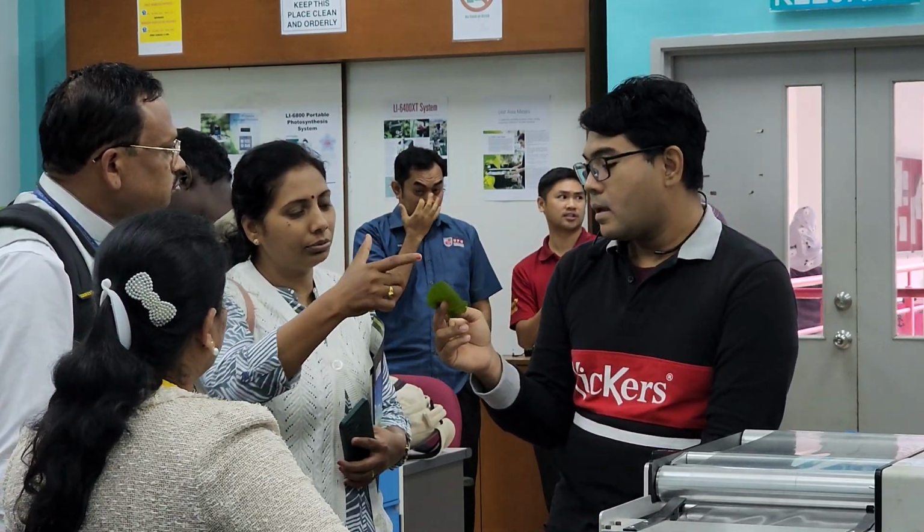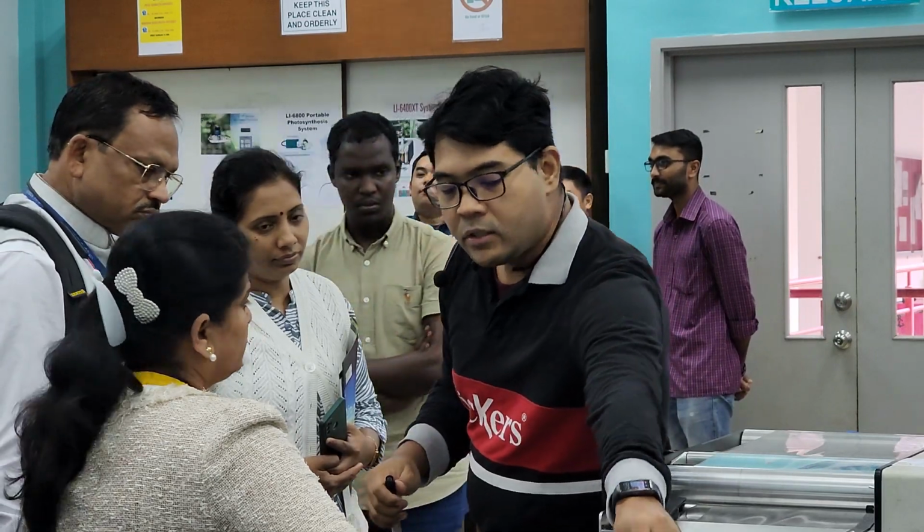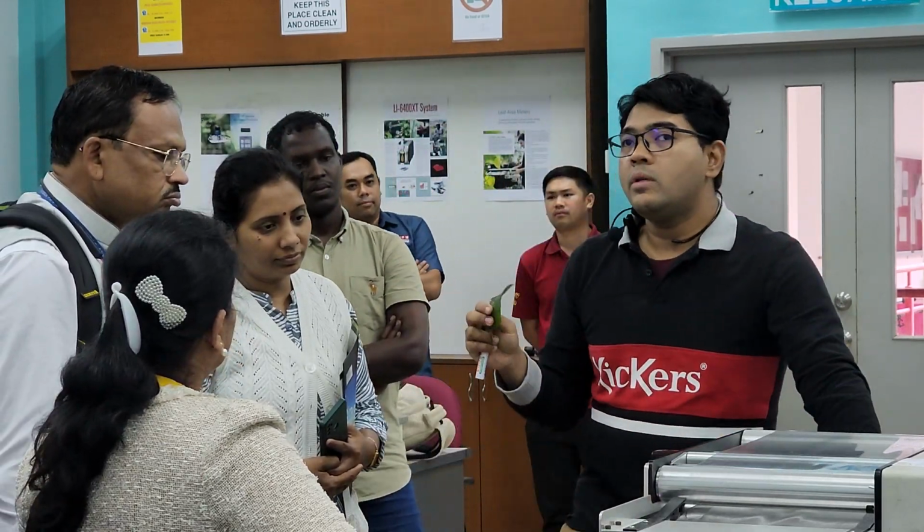If it is yellow due to some disease, you need to combine a number of analyses of the leaf. Number one may be the leaf area, and then you take an image of the leaf and feed it to specialized software. Sometimes the damage on the leaf is not necessarily due to a pest attack.